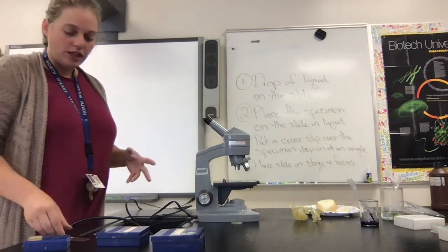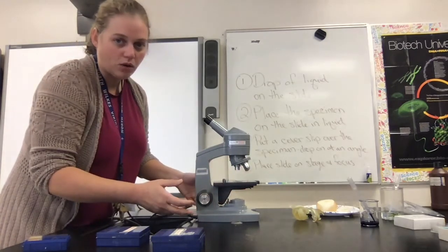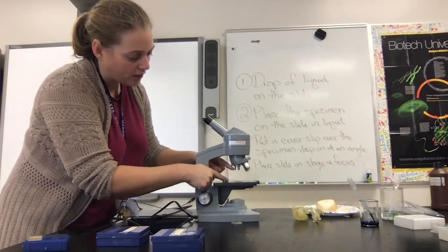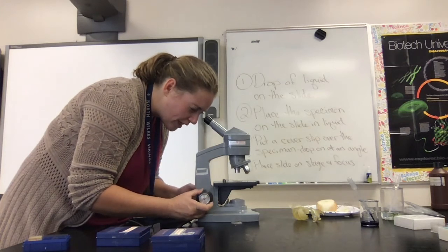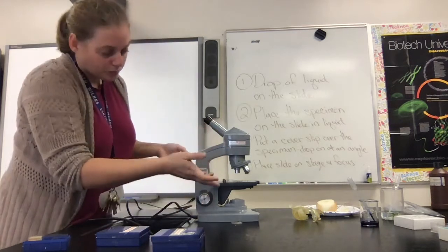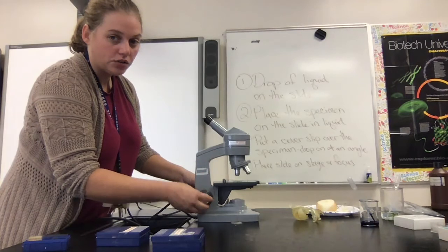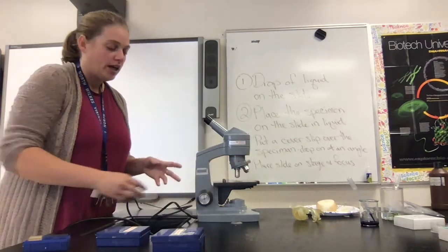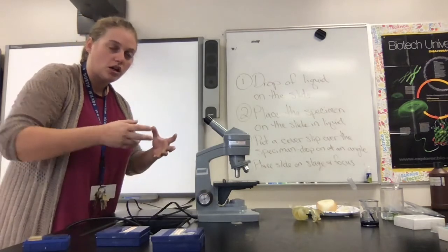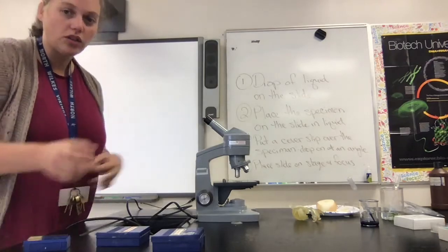To view these preserved slides, place the slide on the stage under the stage clips. Focus the same way as before: start on the lowest power with the objective far from the stage. As you look through the eyepiece, use the coarse knob to lower the objective toward the stage until you see detail. Once you have detail, center the organism and switch to the next highest power, using the fine focus to get more detail. At high power, use the fine focus to toggle back and forth to see different layers and better detail.